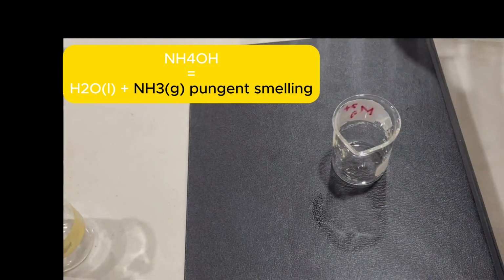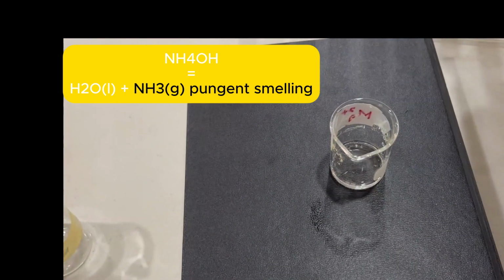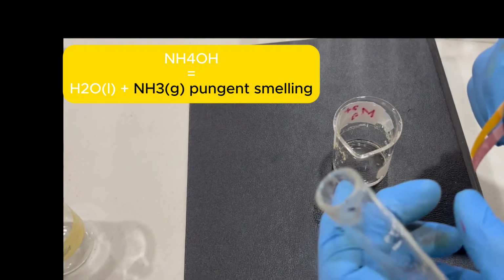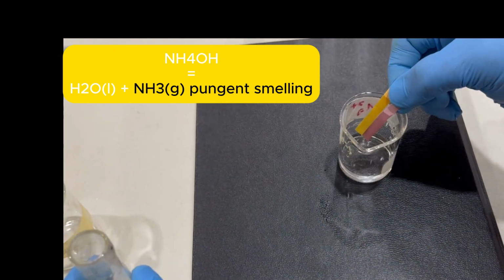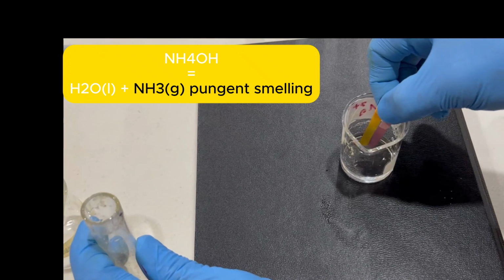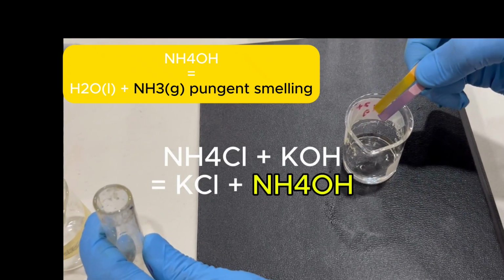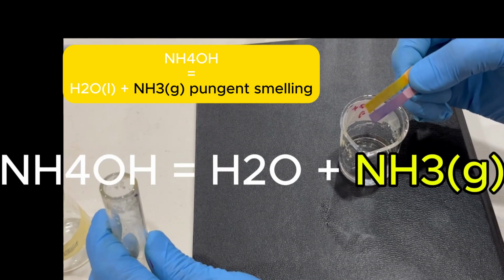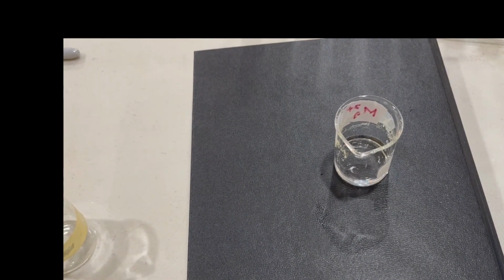So what we'll do now, we'll insert one of them there, and then we pour in the other solution there and see if you see any change in the color of these. See that? You can see the pink litmus paper went blue, and you can see the color of the pH paper change. So that indicates the presence of ammonia gas.